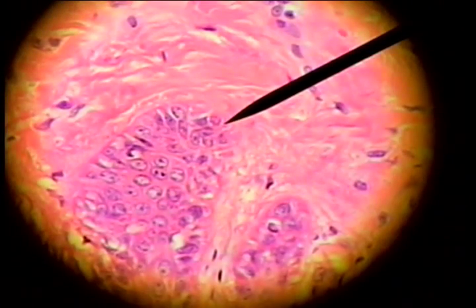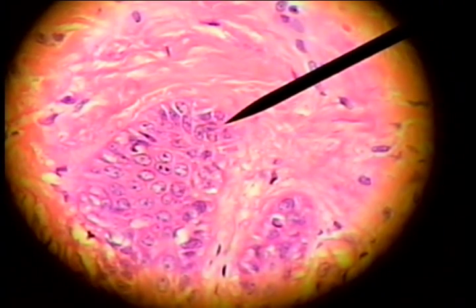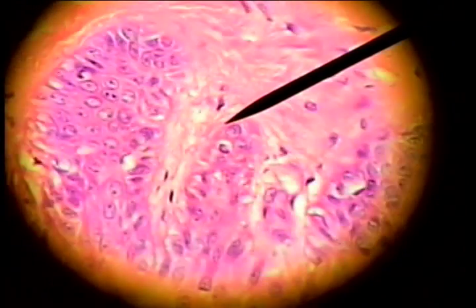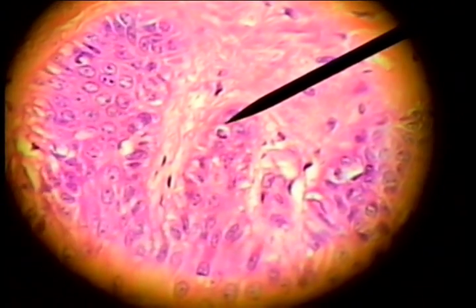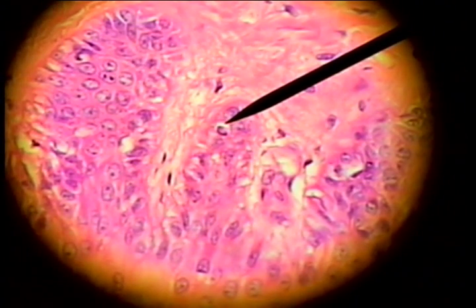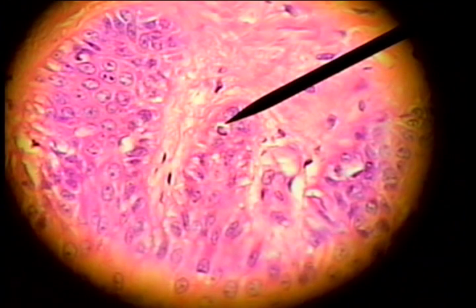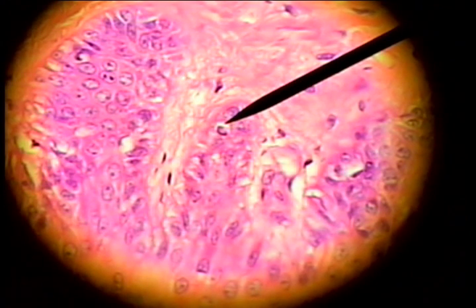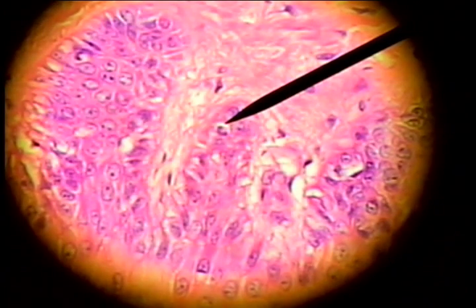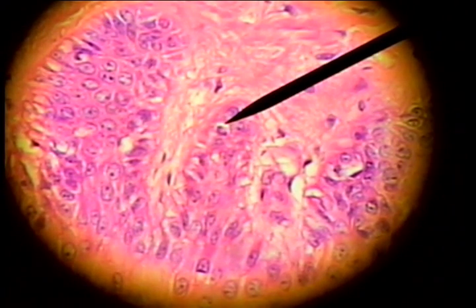Down near the basement membrane is the stratum basale, or stratum germinativum. If we look in the stratum basale, we can see a clear cell, which is either a melanocyte for producing melanin, or a Merkel cell as a mechanoreceptor for nerve reception.